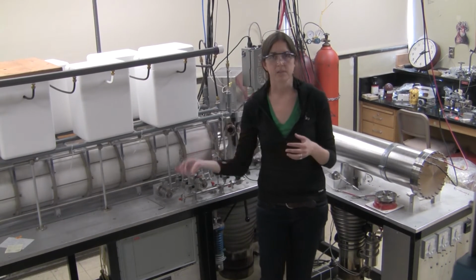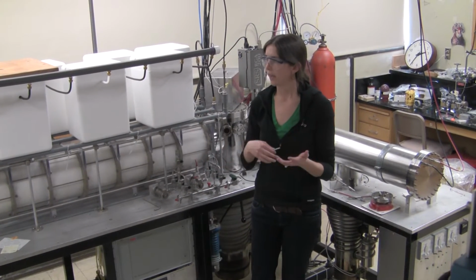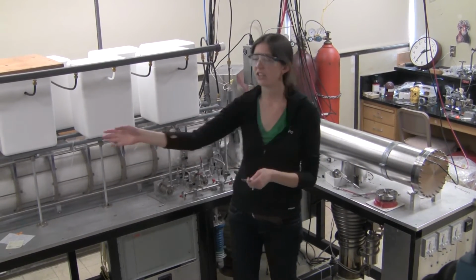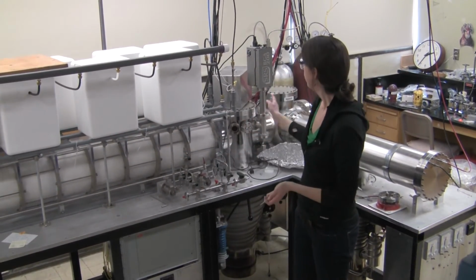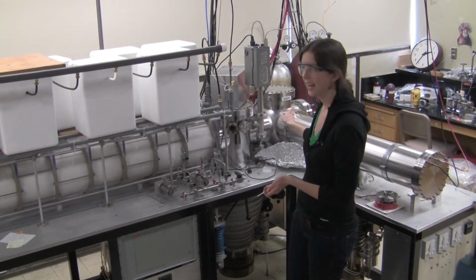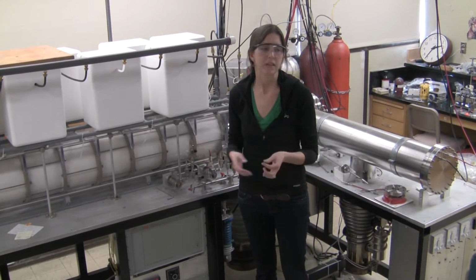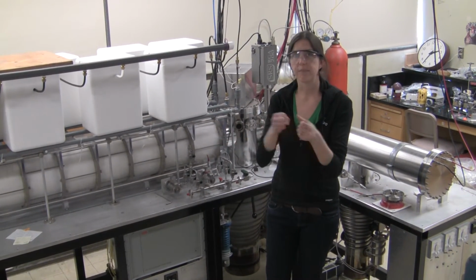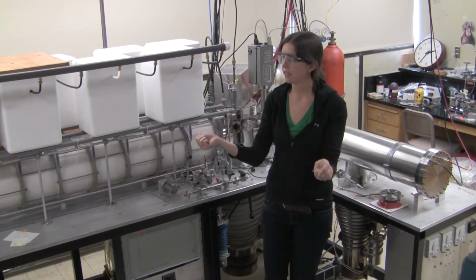So with this instrument we can do 2 types of experiments. We can do a mass spectrometry experiment or an ion mobility experiment. In mass spectrometry, we let the ions just pass directly through the ion funnel, be mass selected by the quadrupole and detected for your normal mass spectrum. To add ion mobility separations, this way we can actually separate mixtures by their sizes and shapes.